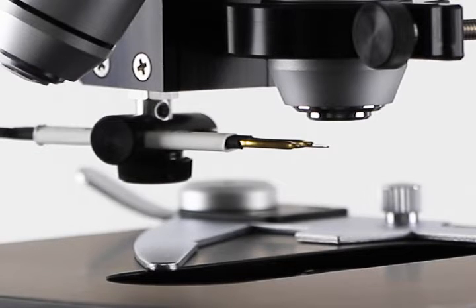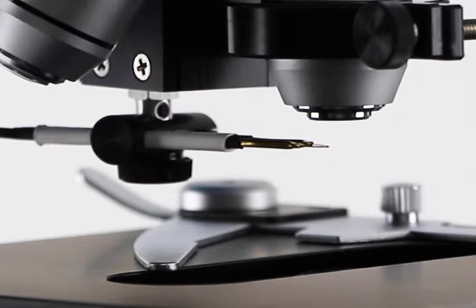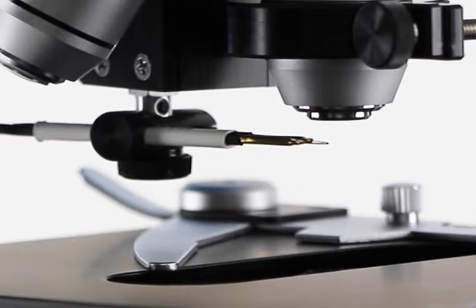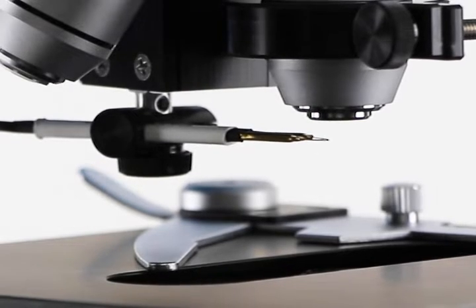Without using the microscope, adjust the position of the filament by moving it in or out and side to side until the filament wire is centered approximately 3 mm below the objective.